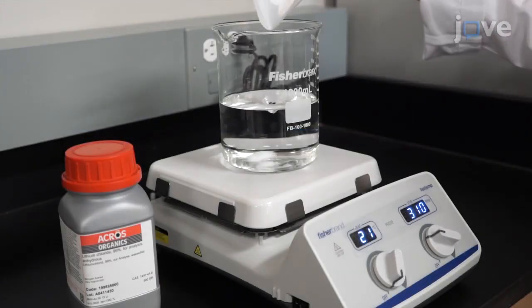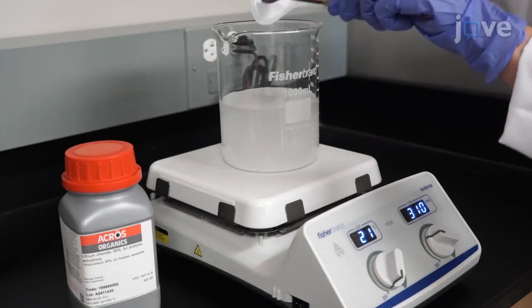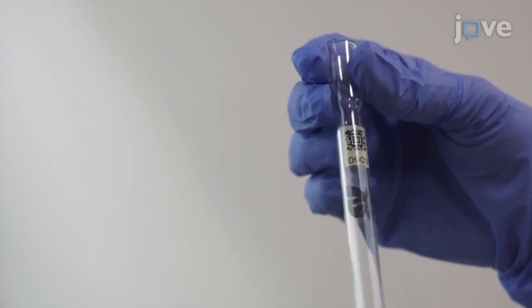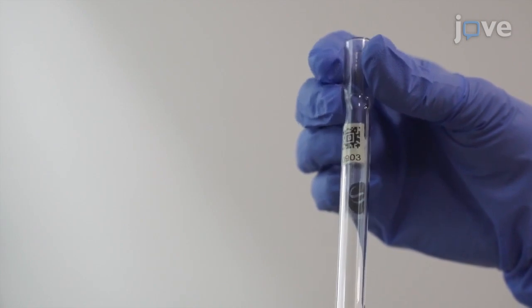Before beginning an analysis, dissolve 25 grams of lithium chloride in 500 milliliters of methanol, and select an aperture tube with a particle diameter range covering the known granule size range of the starch samples to be analyzed.